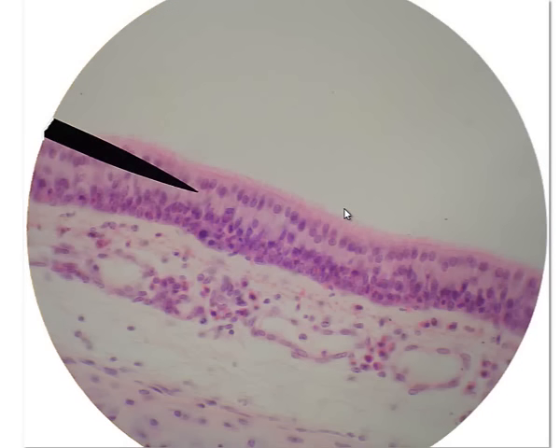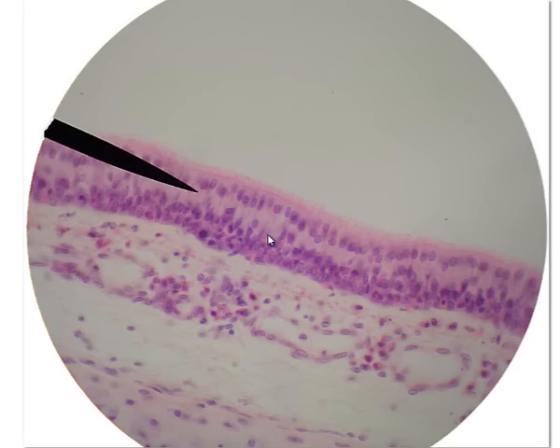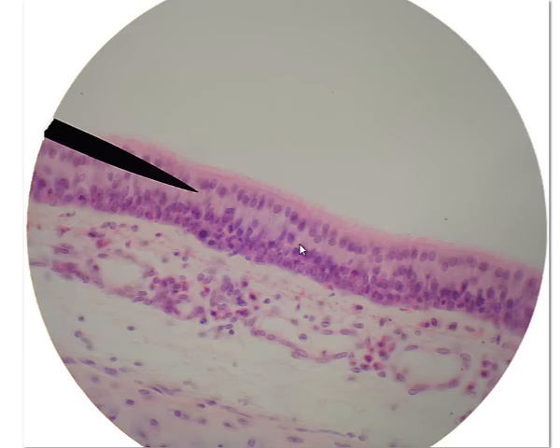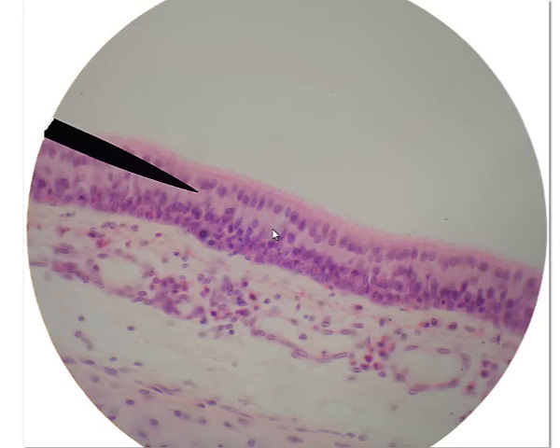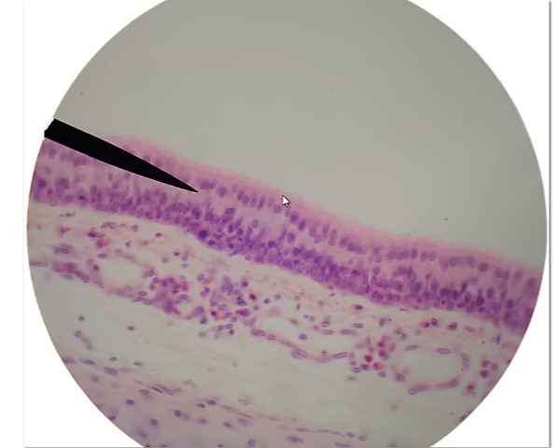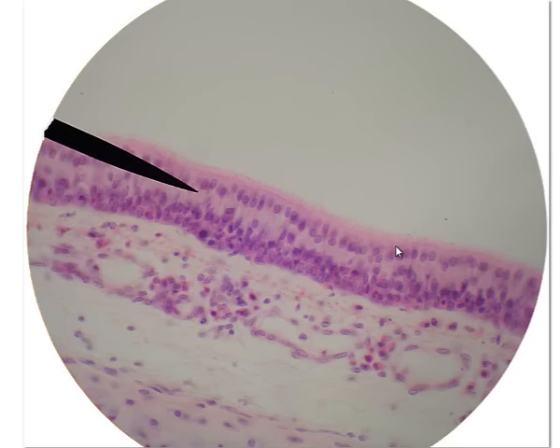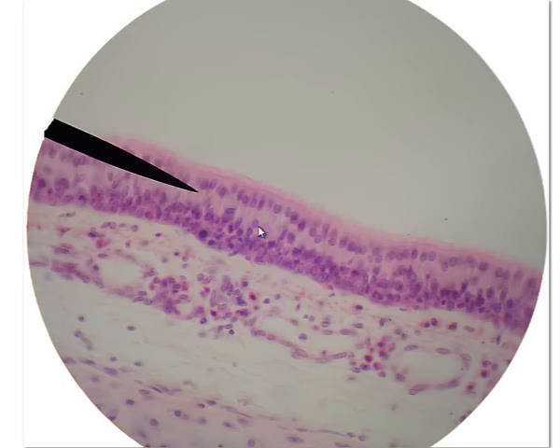Now we're on to epithelial tissues. This one is pseudostratified columnar epithelium. The major features: you have this line of cells but it looks like we have two or even three layers of nuclei, when in reality there's only one layer of cells — that's why it's called pseudostratified columnar epithelium. Another feature is a fuzzy brush-like border — that's cilia on pseudostratified columnar epithelium. This comes from a mouse's trachea; those cilia help to move mucus along the respiratory tract.